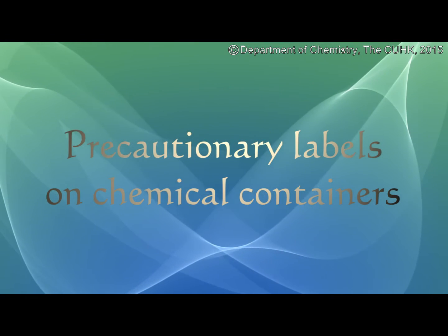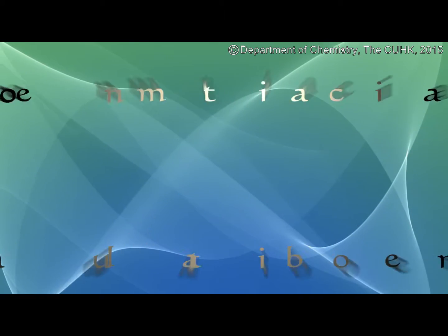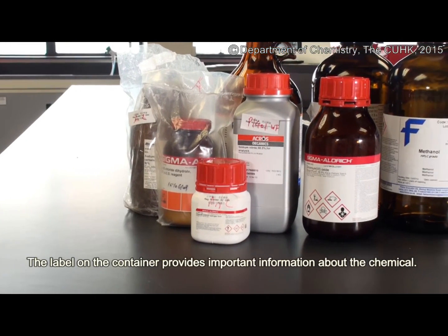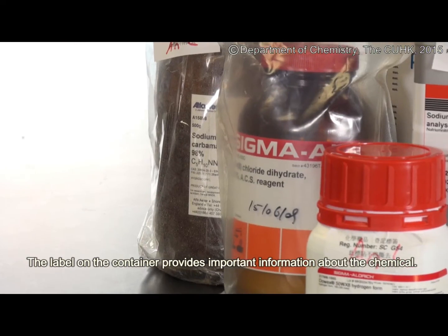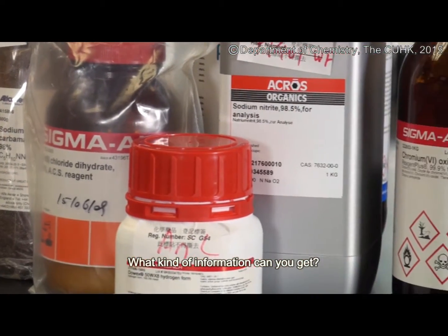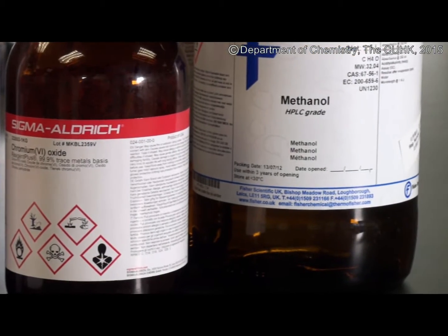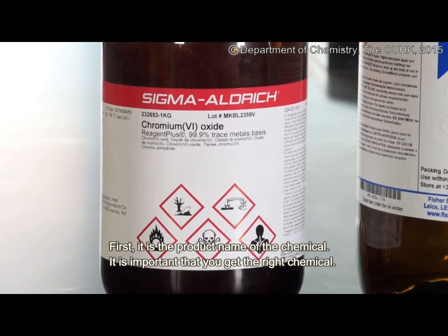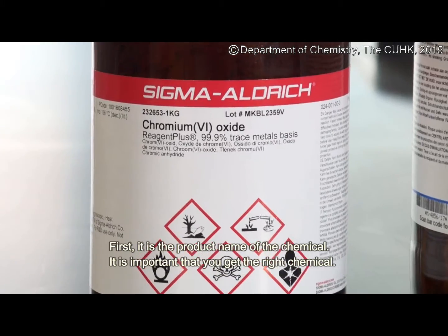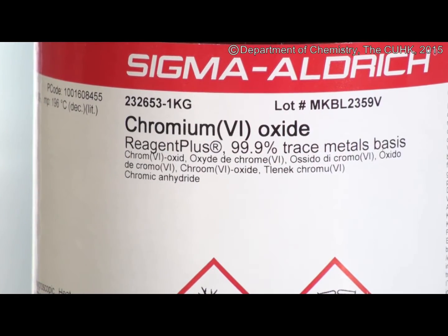Precautionary labels on chemical containers provide important information about the chemical. The label tells you what kind of information you can get. First, it is the product name of the chemical. It is important that you get the right chemical.